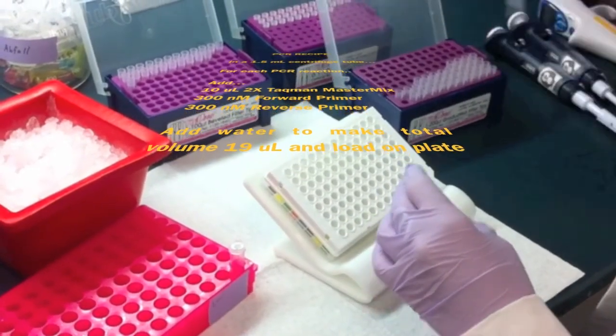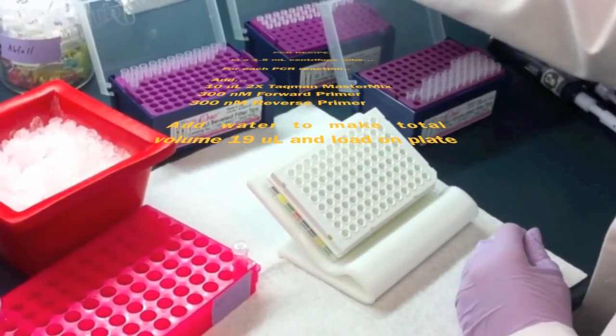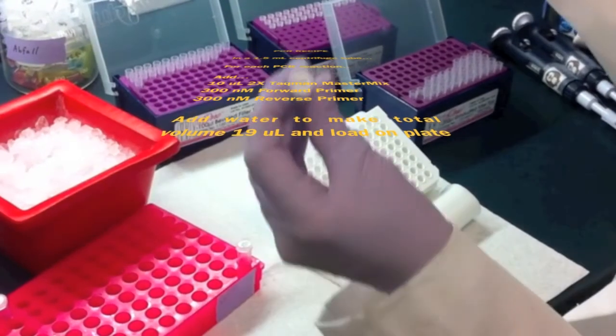Finally, add probe at 100 nanomolars to the target gene MasterMix probe.